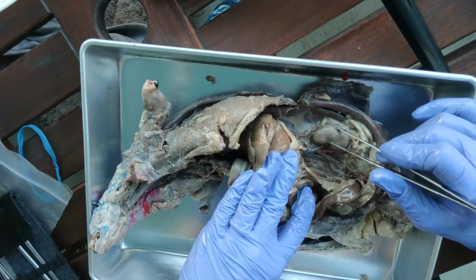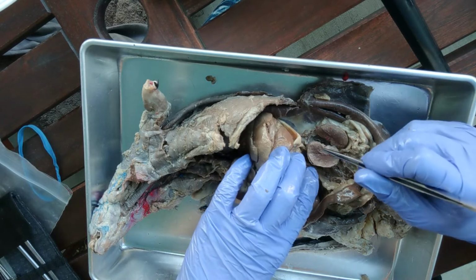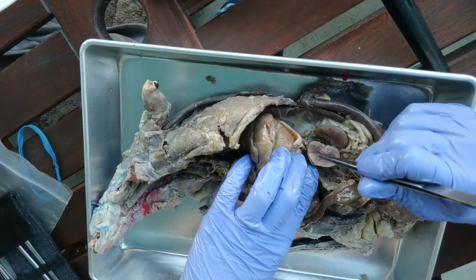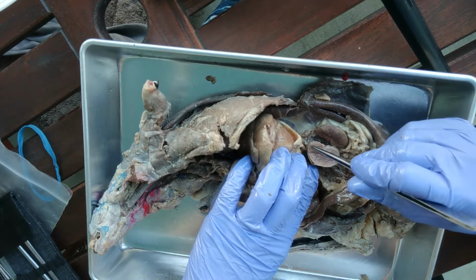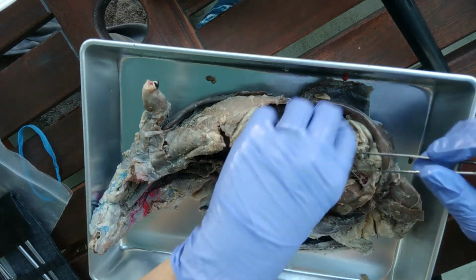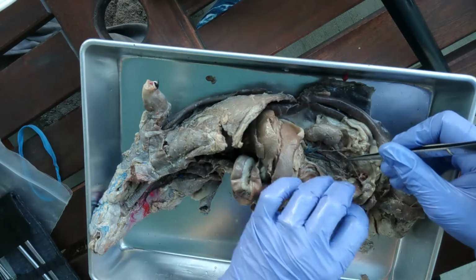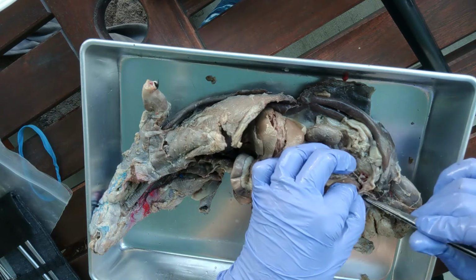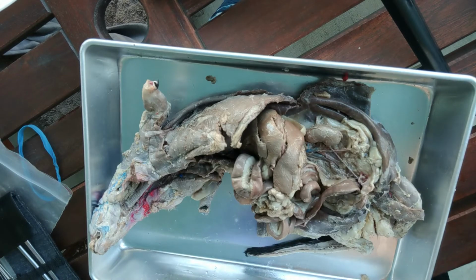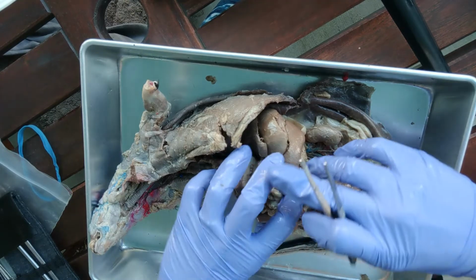And inside of the kidney, we have two functional regions. I cut mine open. Along the outside, that's the renal cortex. In the middle here is the renal medulla. So the urine is going to be created in the cortex, and then the urine will run through the medulla. It'll collect and then run through this tube, which is called the ureter, and then that's going to empty inside of the urinary bladder, and this is where you're going to store the urine, and it'll come out through the urethra. Okay, that's called the urinary system because it makes urine, right?